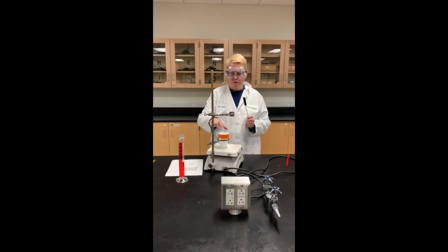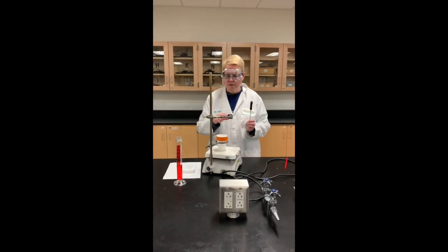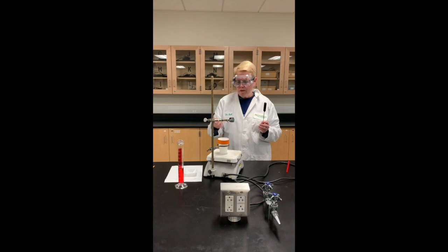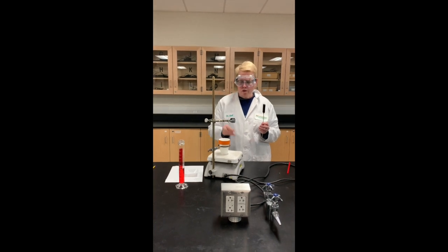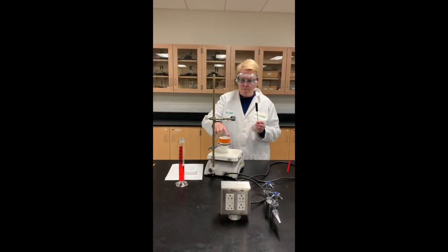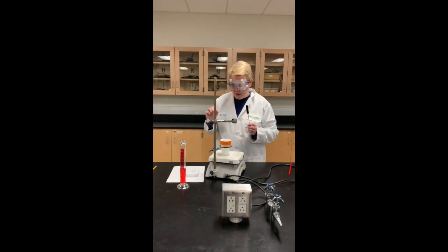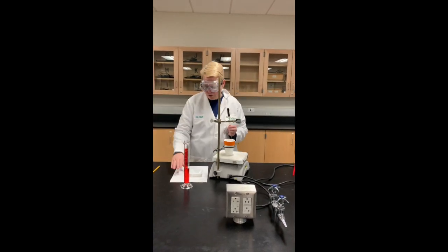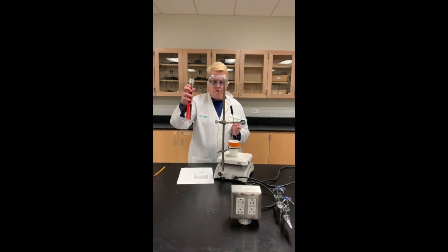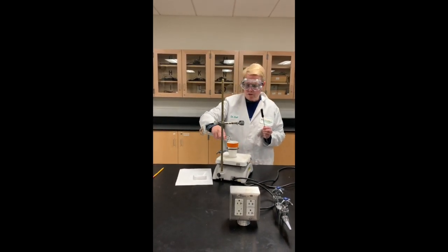Here's the setup — very similar to what we did with the specific heat of the metal — but this time we're going to be using a stir bar and continuously stirring our solution. I've got my styrofoam cup set here, I'm going to put the stir bar in, and then I've measured out 49 milliliters of water in my graduated cylinder and we'll pour it into the cup.